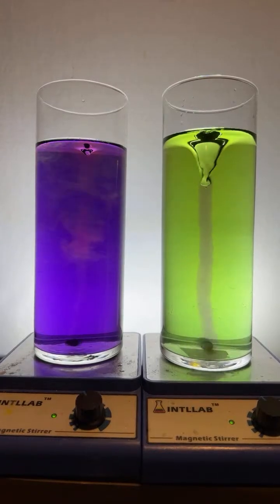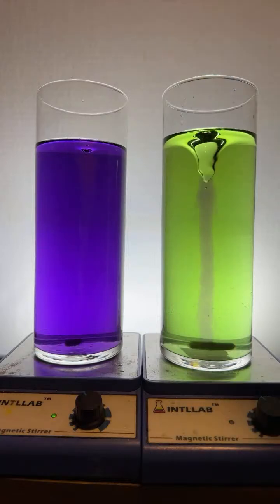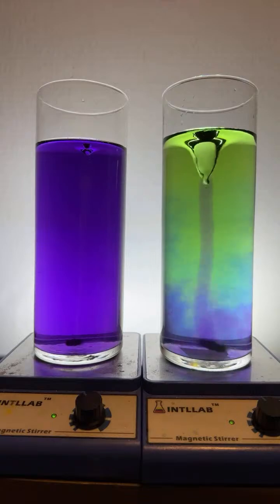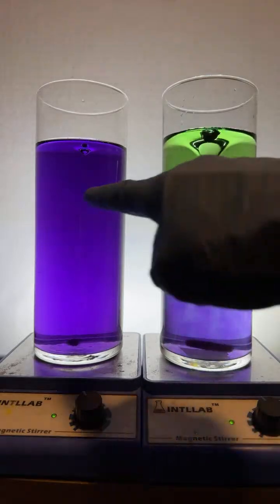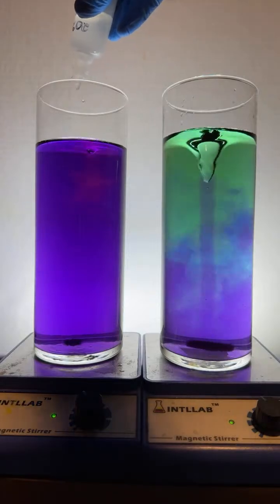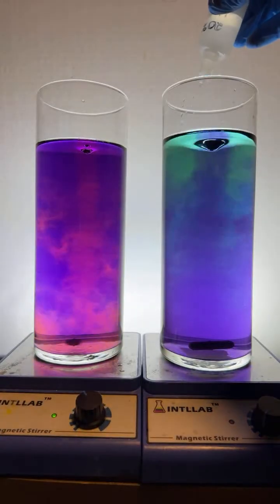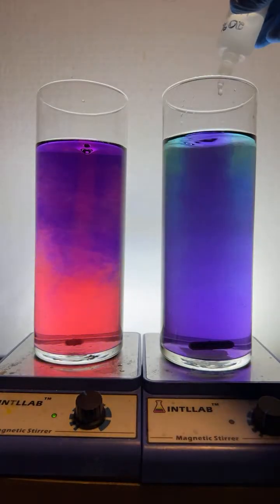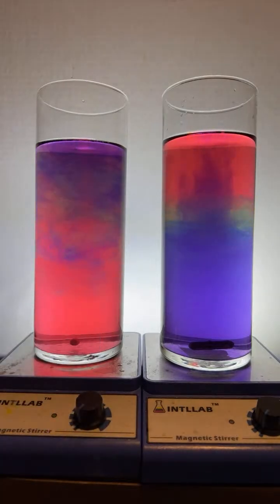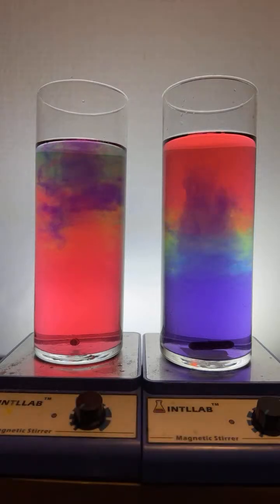Oh, L Boy Willie, how and why does it change color? I'm going to answer this in a simple way. This takes a little bit of theory. It's more complicated than this because there are actually 4 different dyes in these systems. I'm just going to talk about one of them because it's the simplest way to talk about it. All right, let's turn this off and let's add a bunch of acid here. Let's just see what happens if I add it. We're just going to watch the magic happen while I talk about this. So how does it change color? Look at that. We got a little rainbow going on over here.